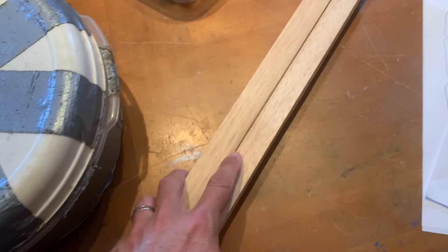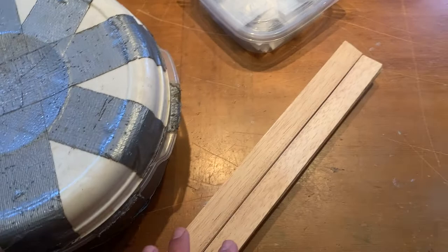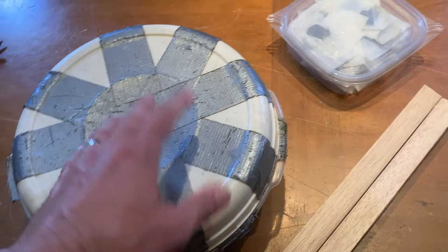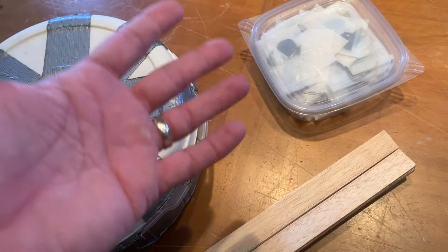If you're going to mount butterfly and moth specimens or beetle specimens, it is definitely always better to mount them when they're freshly caught, so they have their natural body fluids. Rehydration chambers are great and they enable you to store your specimens in envelopes and then rehydrate them at a later time.